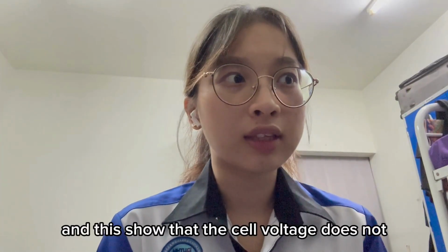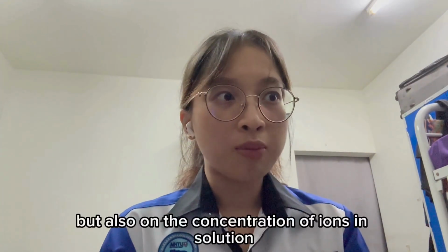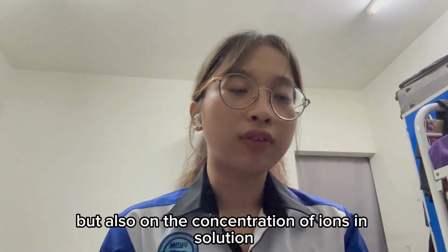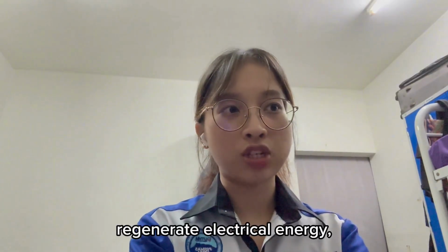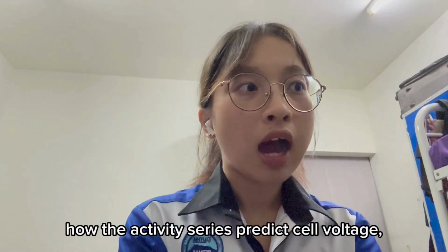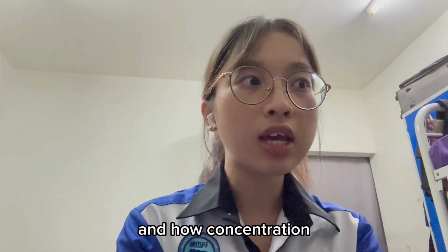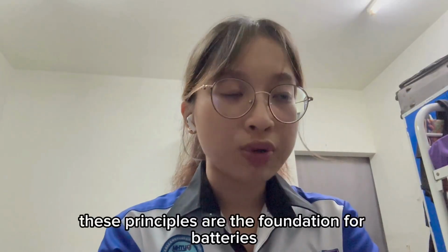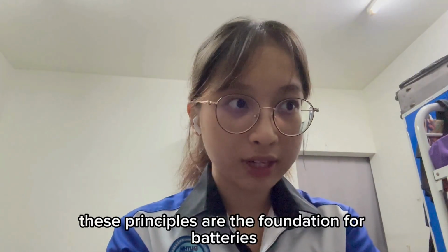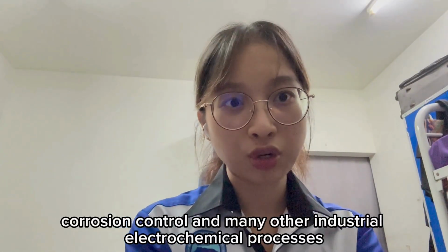This shows that the cell voltage does not depend only on the metal used, but also on the concentration of ions in solution. Overall, the experiment helped us to see how redox reactions generate electrical energy, how the activity series predicts cell voltage, and how concentration differences can also drive an electrochemical cell. These principles are the foundation for batteries, corrosion control, and many other industrial electrochemical processes.